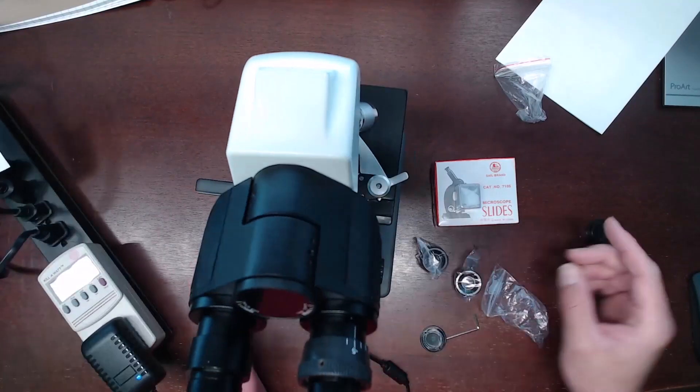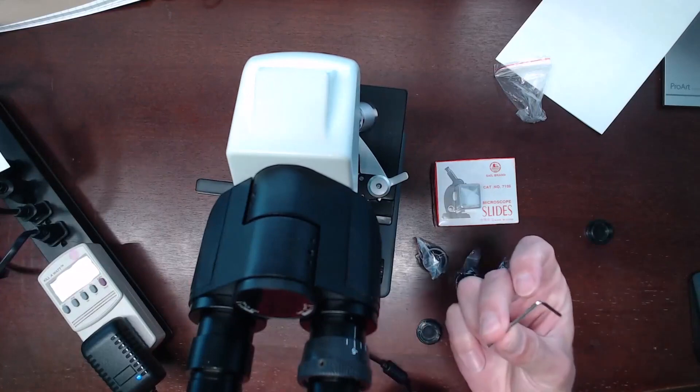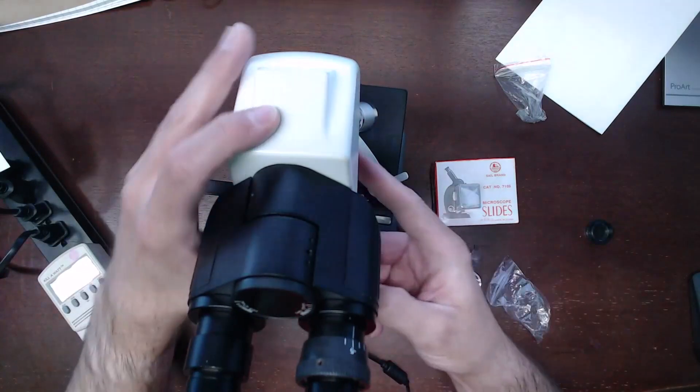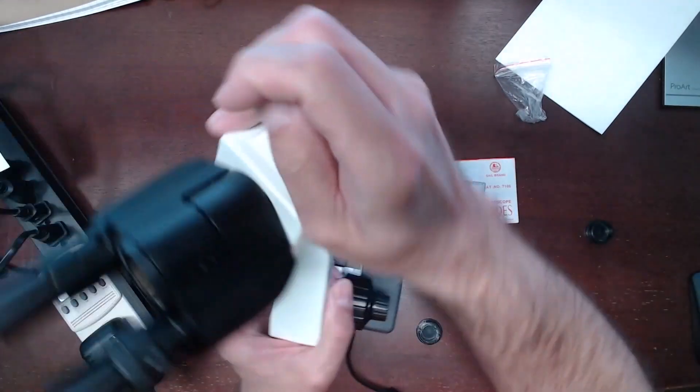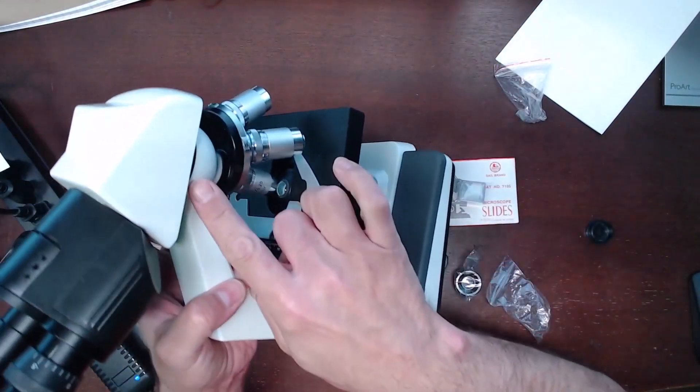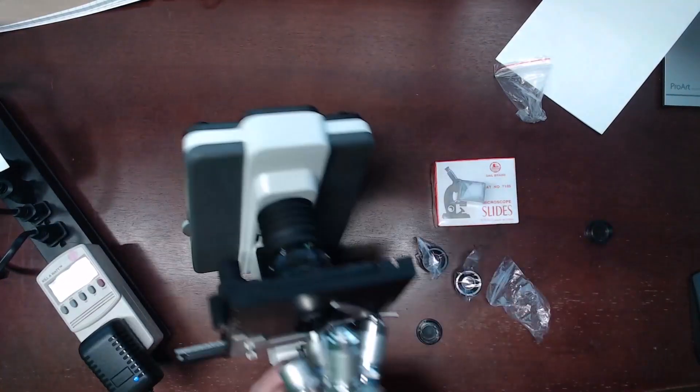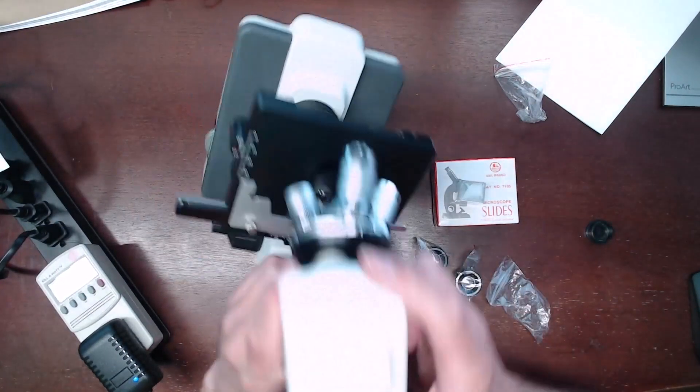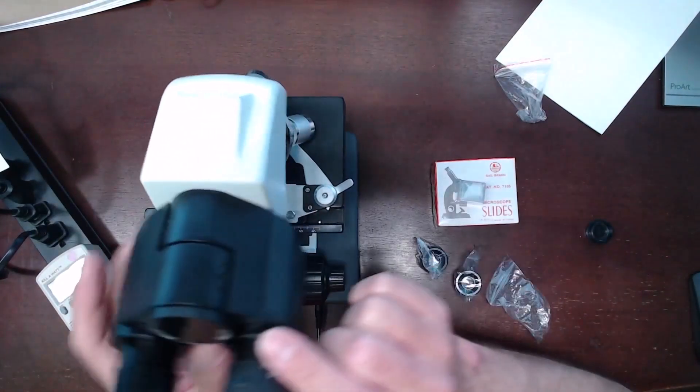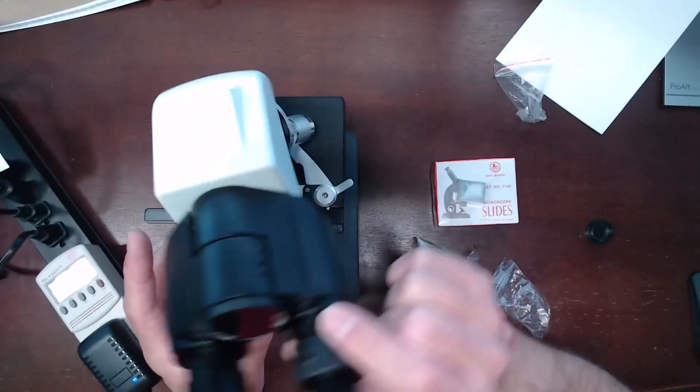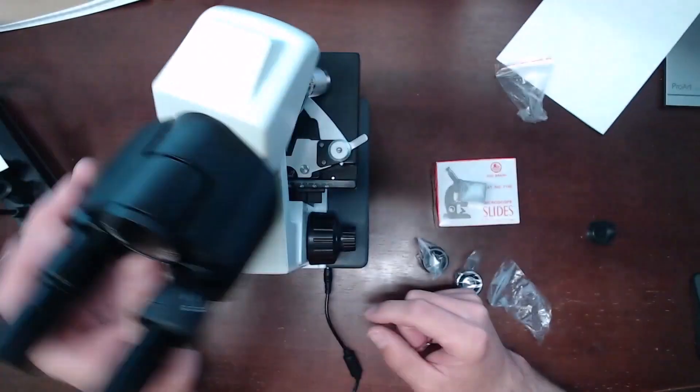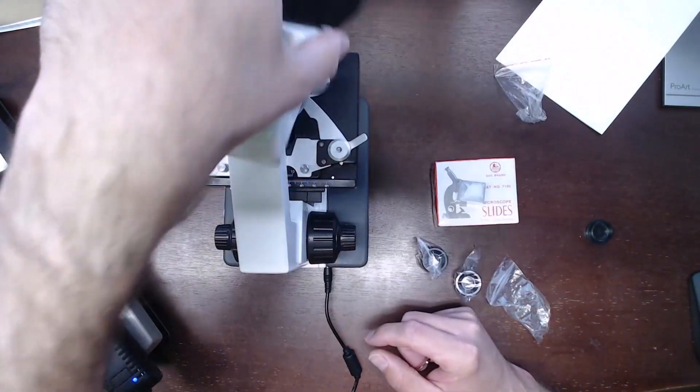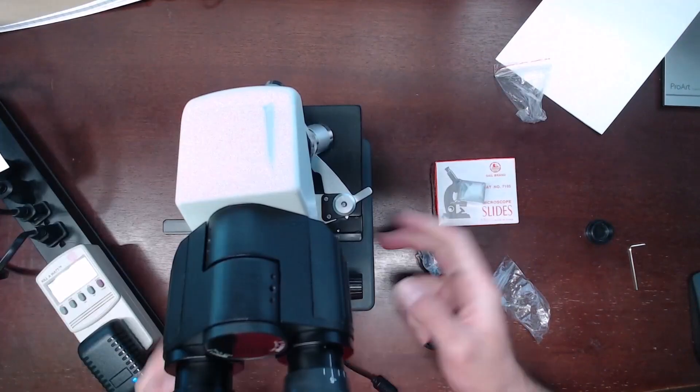The final step - you need to take the small allen key. There are three recessed screws. I have already loosened mine by the way. There is one on the right side, one on the left side, and one on the front. You need to loosen those just a little bit to unlock the ability and allow the binoculars to swivel in that 360 degrees. Once you get this turned on you are good to go.